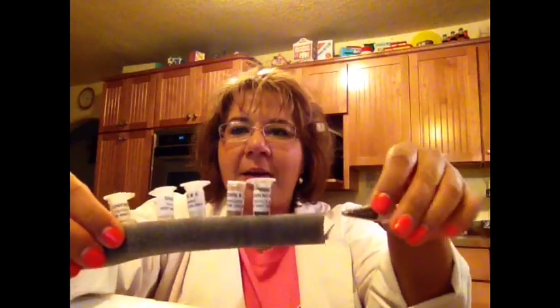Once you have your unknowns ready, your instructions tell you to take sample number one and record first the color of it. Look at the tube and note what color is the substance in the vial. This is not a trick question — it's kind of a dark brown color. On data table number one, in the first box highlighted in yellow, record the color of unknown number one — just put 'dark brown' or whatever color describes that vial. You'll do the same for the remaining five unknowns: what is the color of samples two, three, four, five, and six?